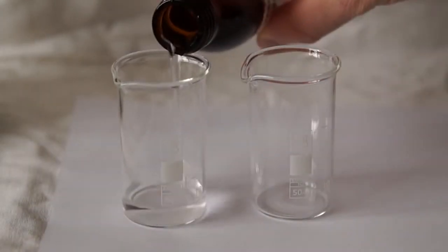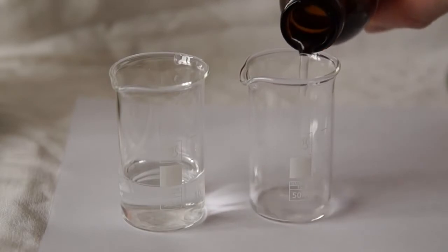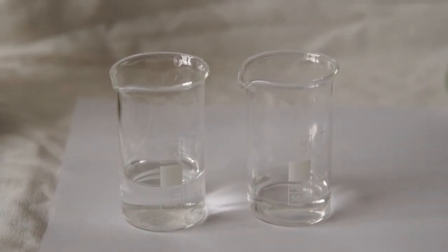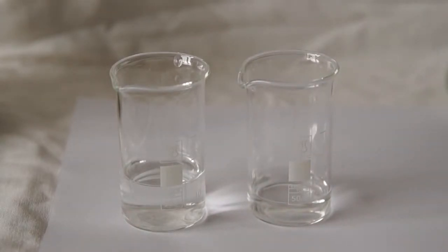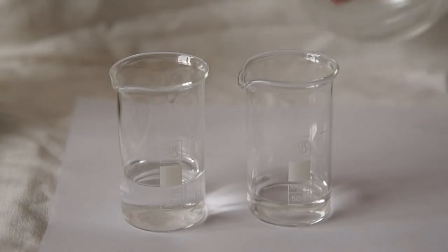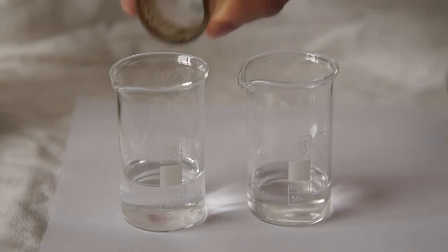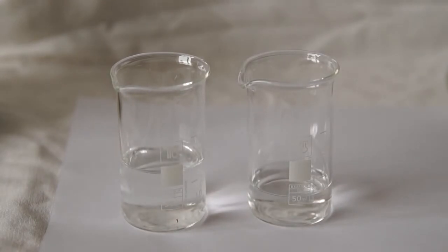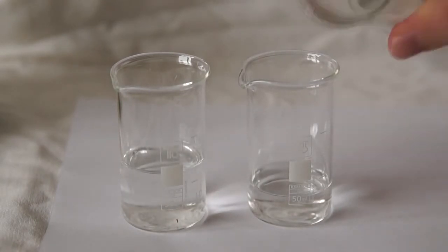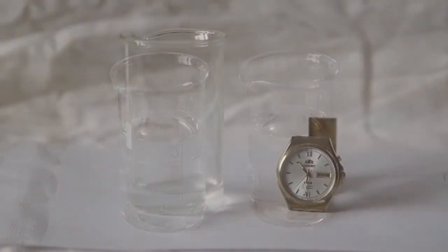Next, let's make a second working solution. That solution may be of various concentrations. For this purpose, I pour into each beaker a different amount of 30% hydrogen peroxide. The solution was acidified and diluted to 40 milliliters.